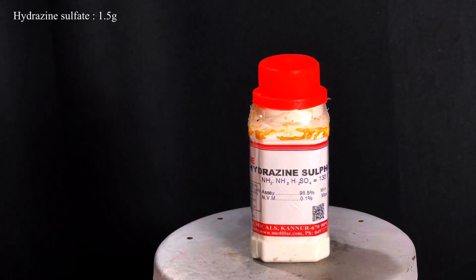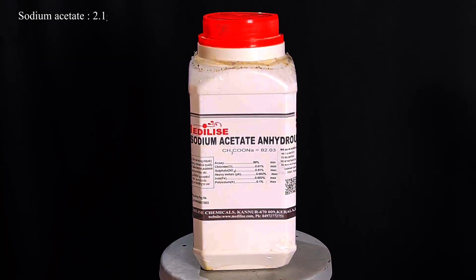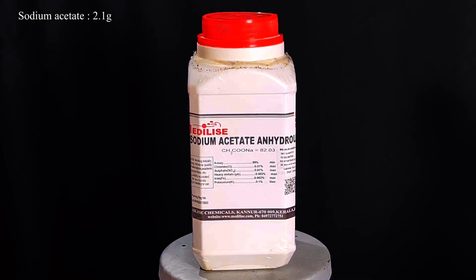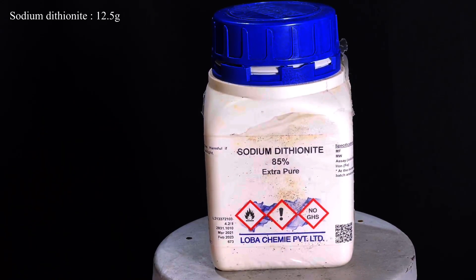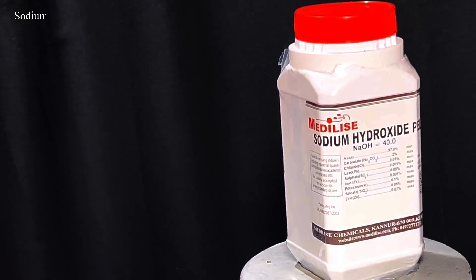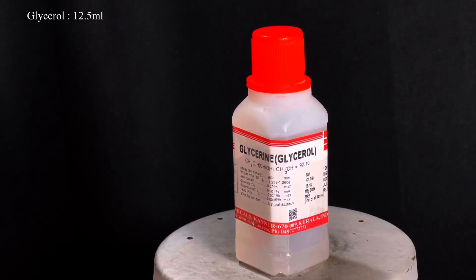1.5 grams of hydrazine sulfate, 2.1 grams of anhydrous sodium acetate, 12.5 grams of sodium dithionite, 5 grams of sodium hydroxide, and 12.5 milliliters of glycerin.